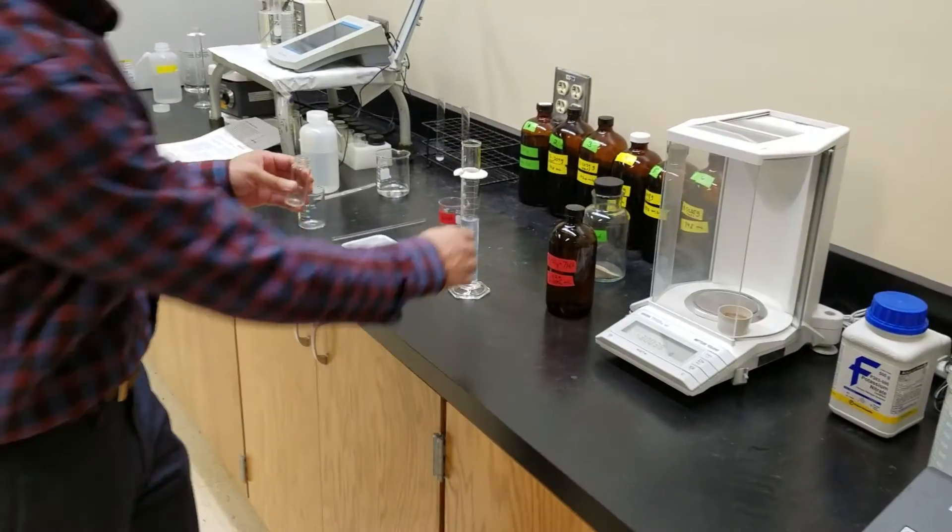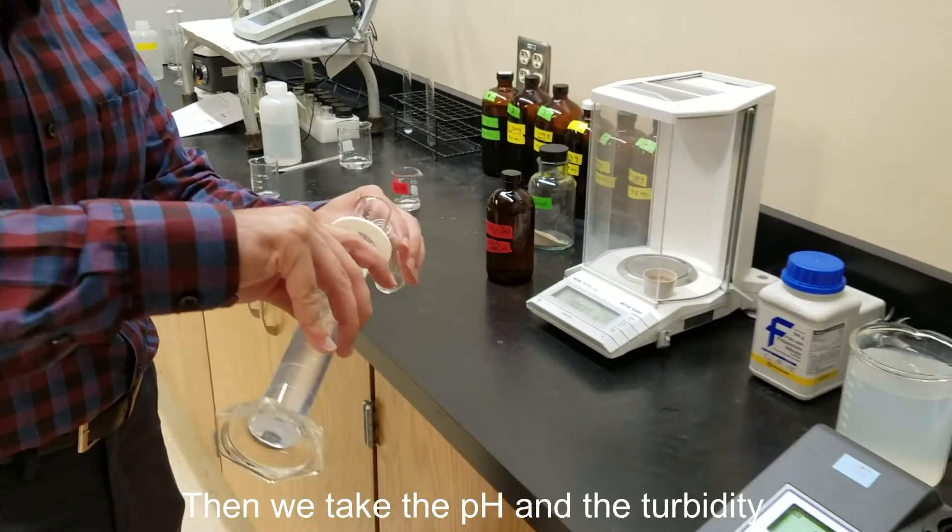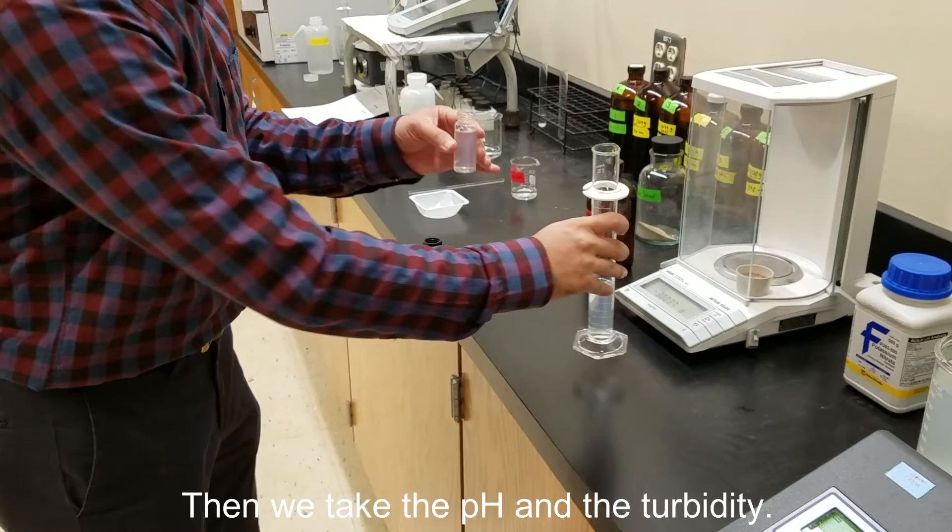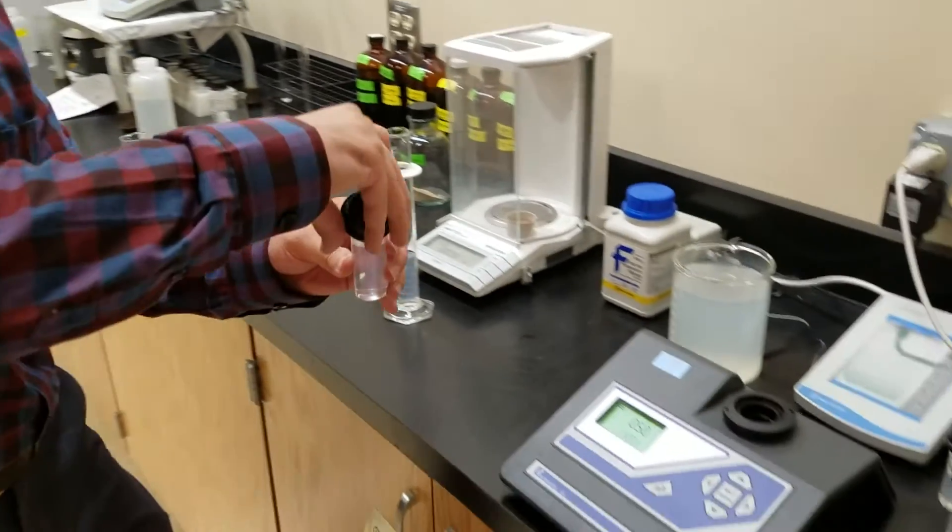And then we'll take the pH of the final solution and the turbidity. This video doesn't show how to take the pH, but you know how to do that.